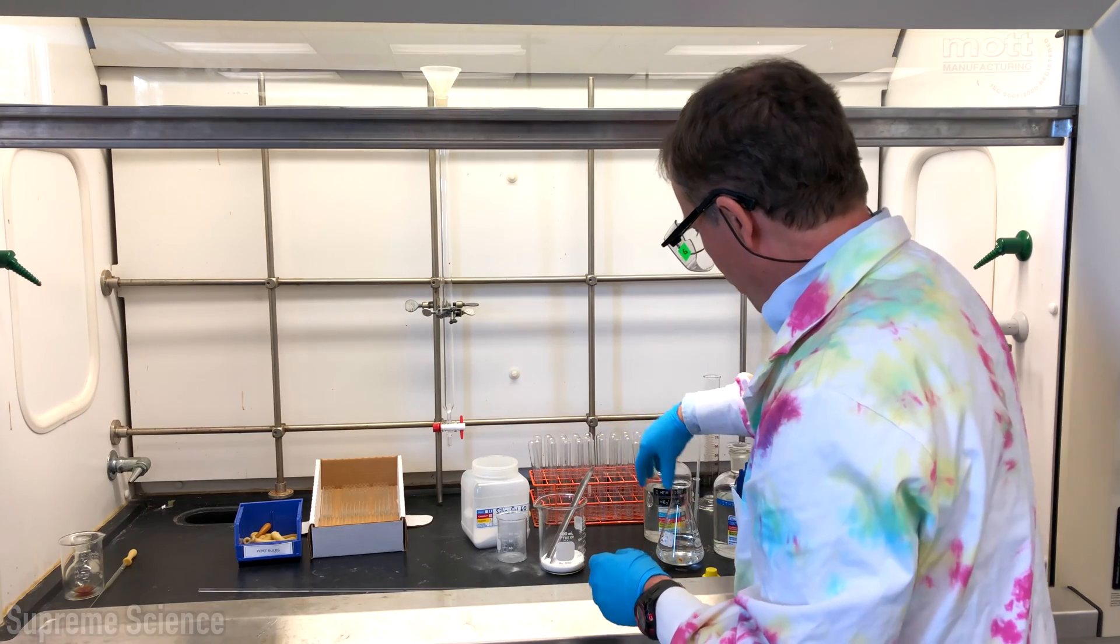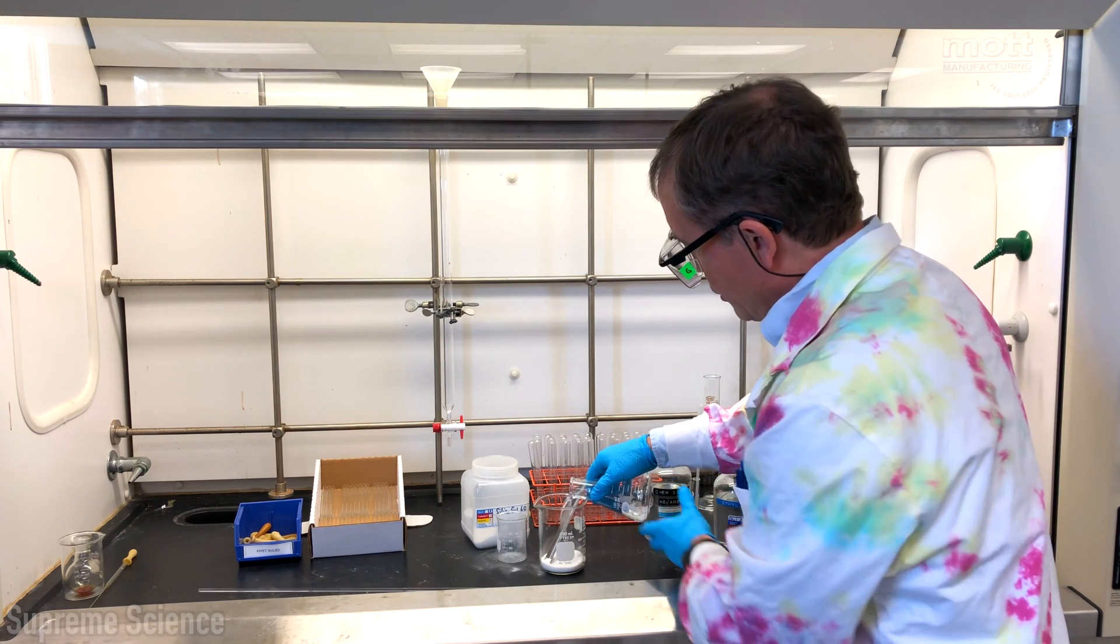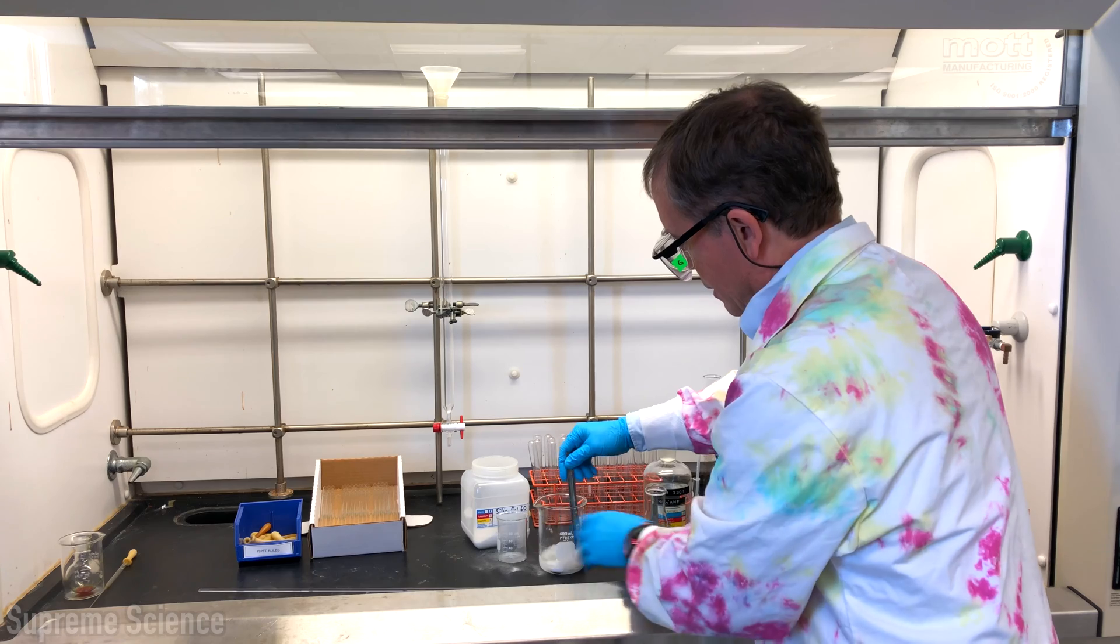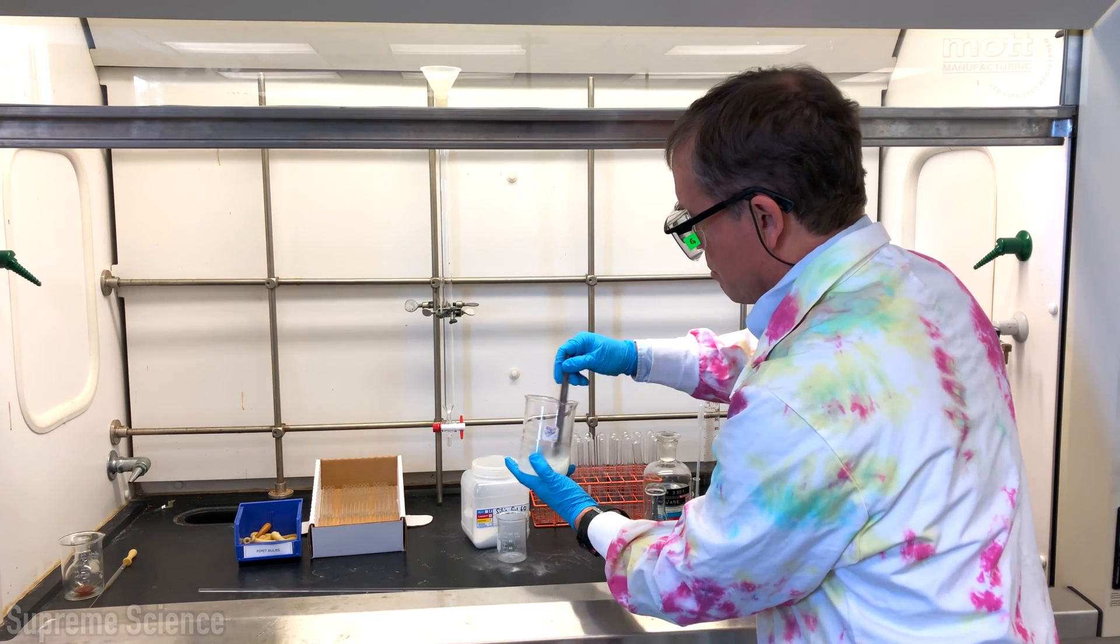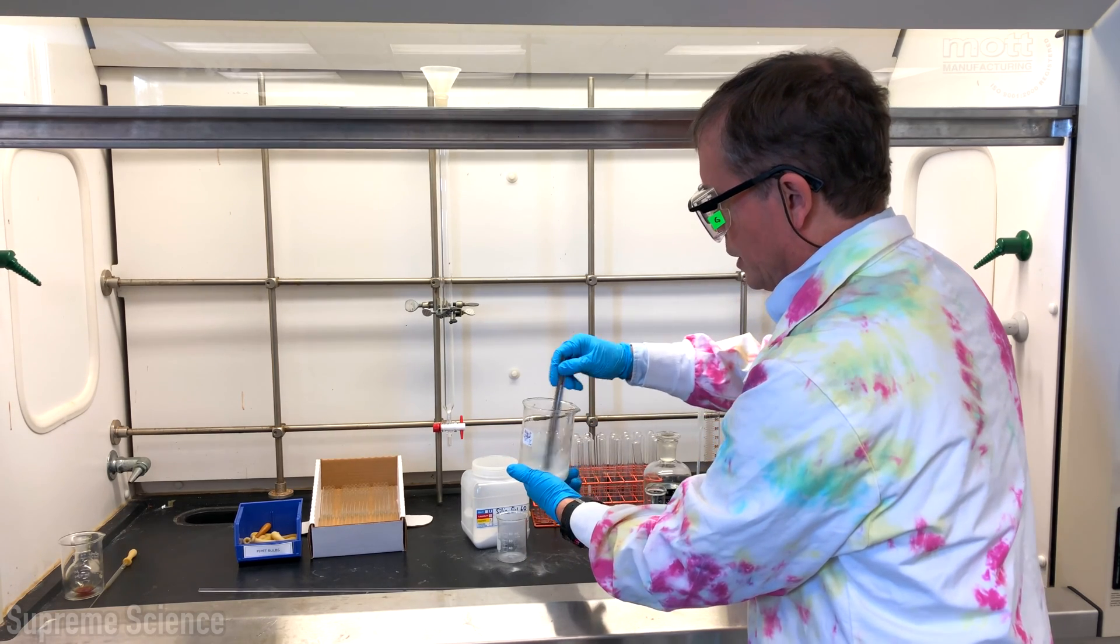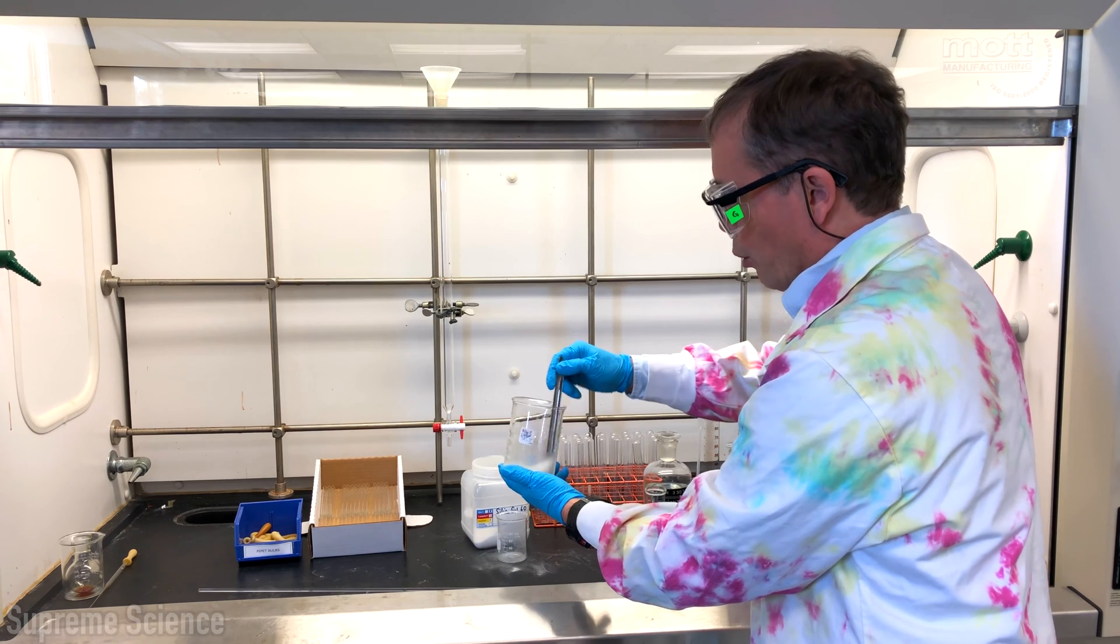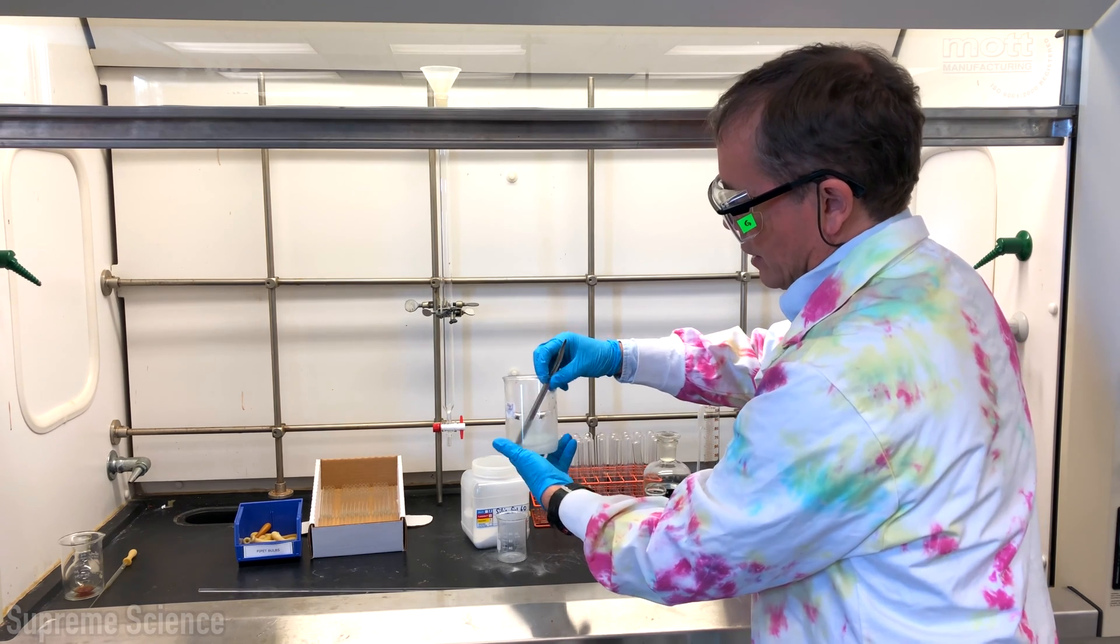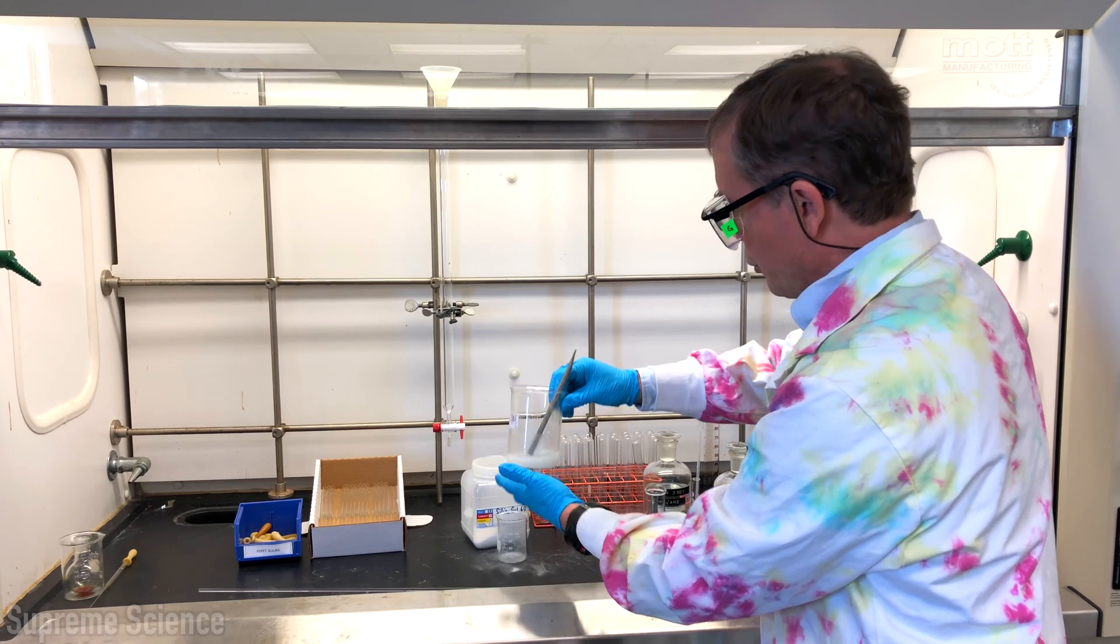Now we pour in our two to one mixture of solvents into the bigger beaker and mix it to a consistency that's pourable. It doesn't want to be too thick, doesn't want to be too runny. That looks about right. Now I'm going to put that aside.